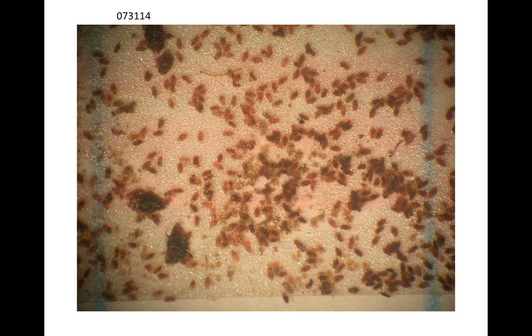John, so Mike, we could put in parentheses after that, if we continue with that terminology, immatures, and then in parentheses, crawlers, and then what you're saying morphologically you may be seeing, so that the reader knows what groups you're up to. Some stage of the early stage nymphs, I guess. Is that correct, Mike? Yeah, that looks like a pretty big change in size, that might be a third instar nymph that you're looking at in this picture.